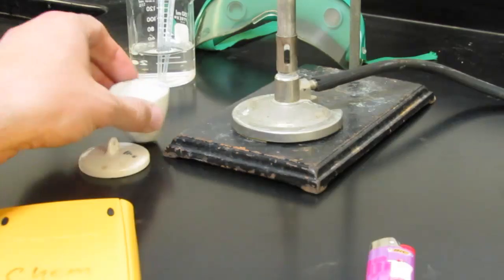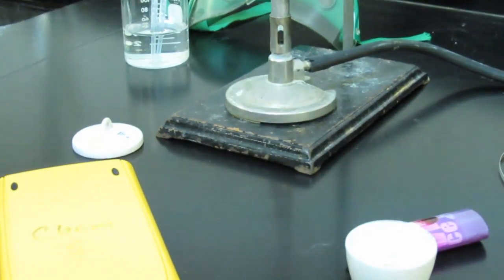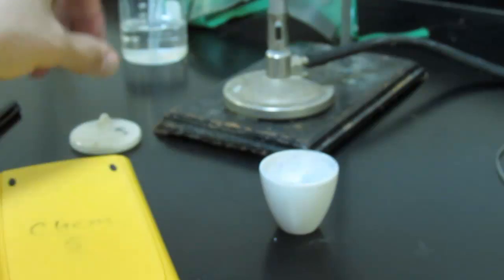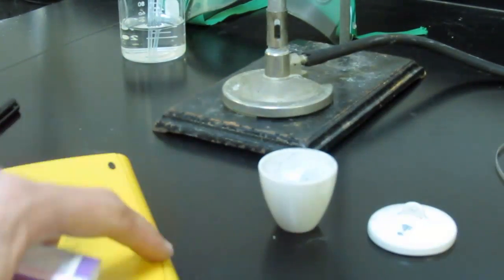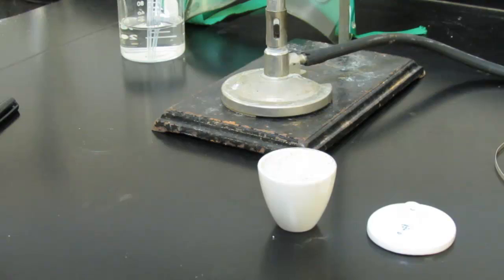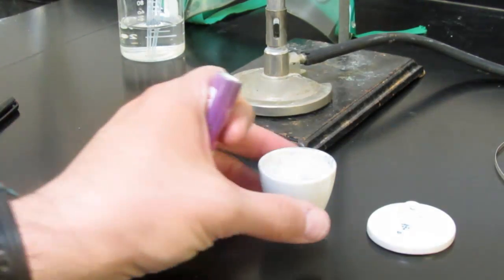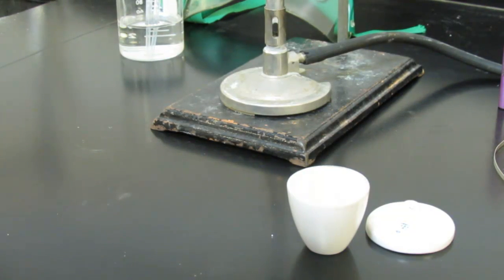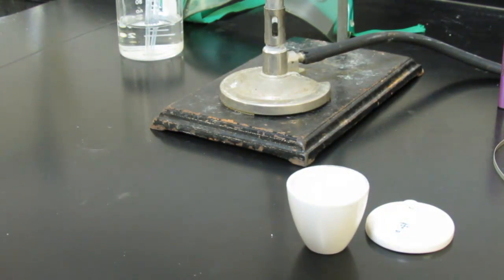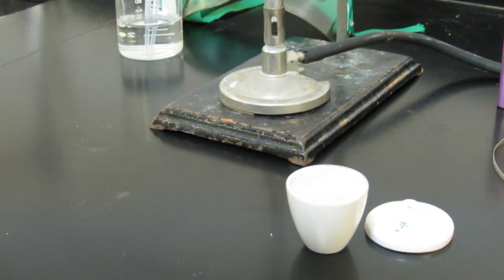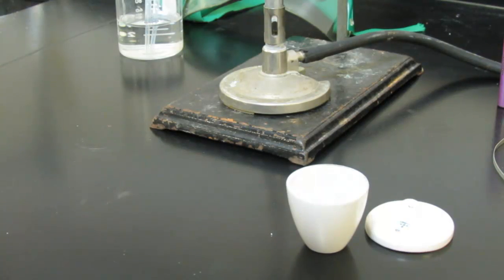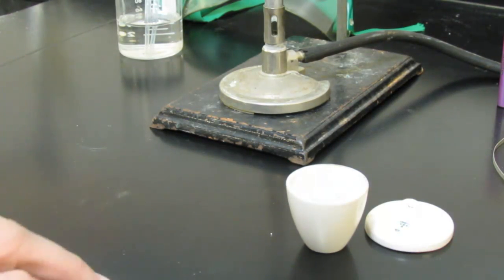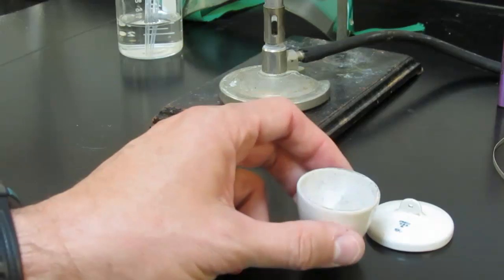So you'll see we have a crucible and a cover for this experiment. This is called a crucible, and of course this is the cover that goes with that. Be careful with the crucible and cover. They're made out of porcelain, and that of course is very delicate and they break easily. In fact, just during the normal process of heating and cooling several times, the porcelain crucible oftentimes will crack. But try not to drop them. They're expensive, they're about $20 a piece. So I do expect some breakage, but try to be careful.